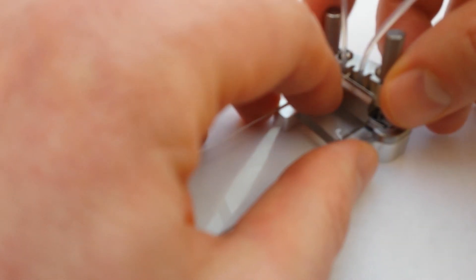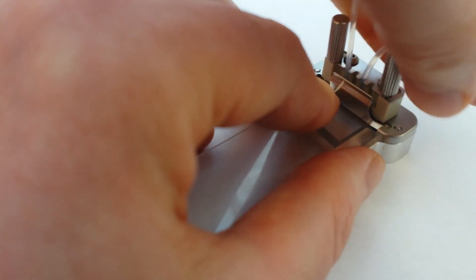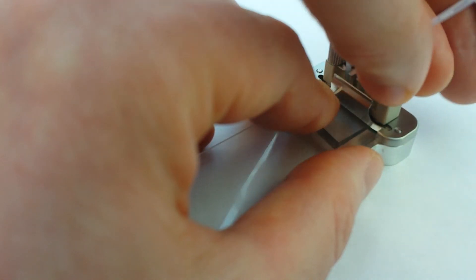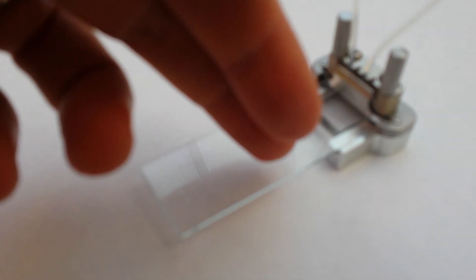Now I'm going to bring Dolomite's connector in and twist it on. So if I turn that around — PDMS here, glass on top, and connections on there. That's a very elegant way of connecting to a microfluidic device. Thank you very much.